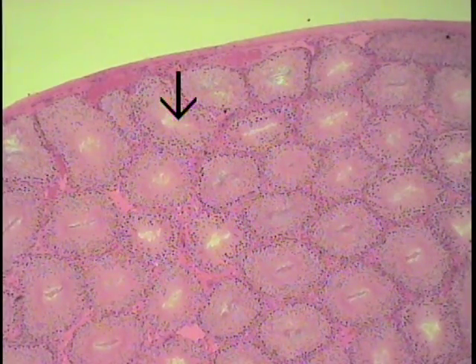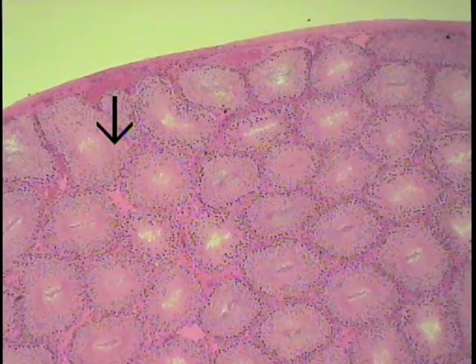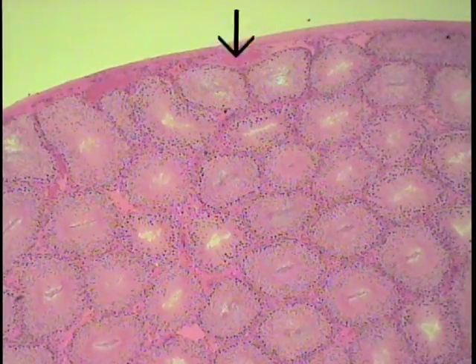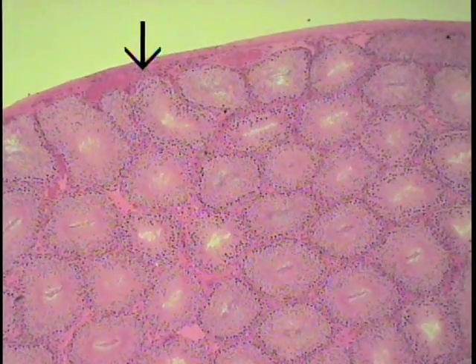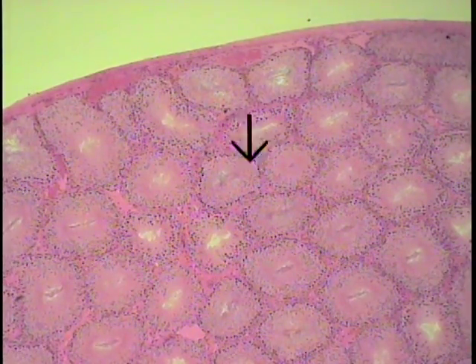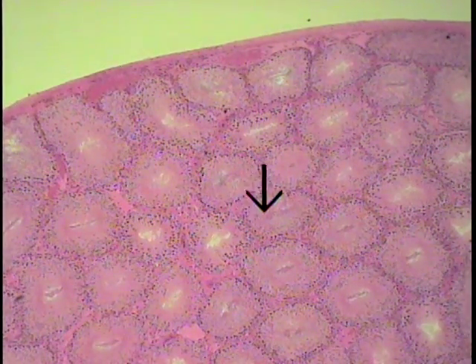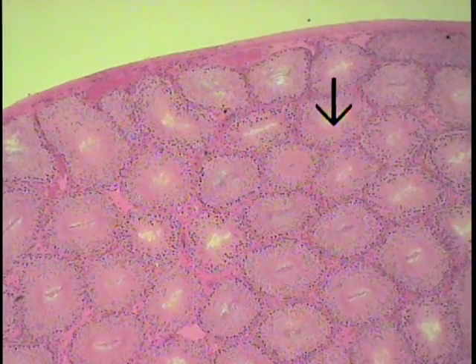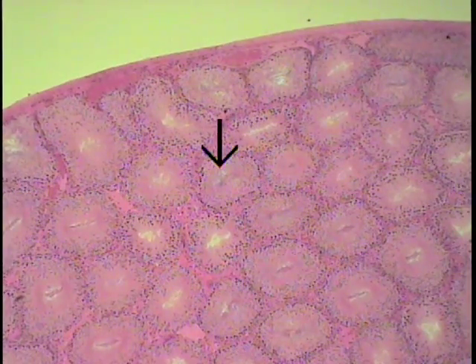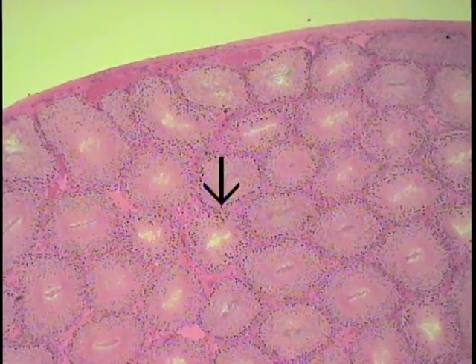Even with the scanning objective, which is shown here, these particular items can be made out even at this very low magnification. This surrounding capsule of the testis, relatively thick, is known as the tunica albuginea, or the white tunic. Scattered within the substance of the testis itself, one can make out numerous tubules cut in cross section, referred to as the seminiferous tubules, which contain the germinal epithelium.